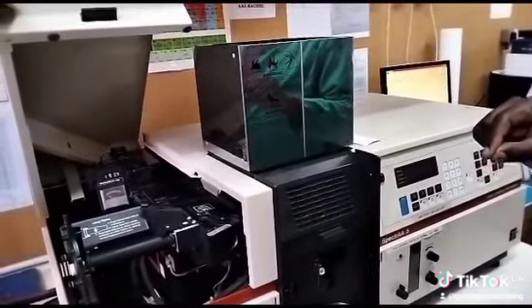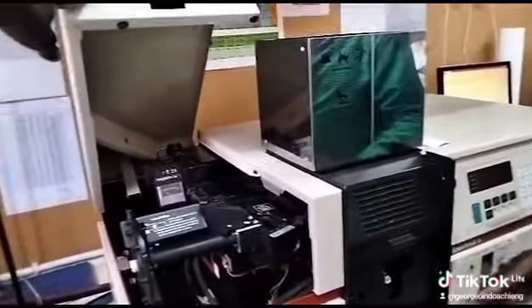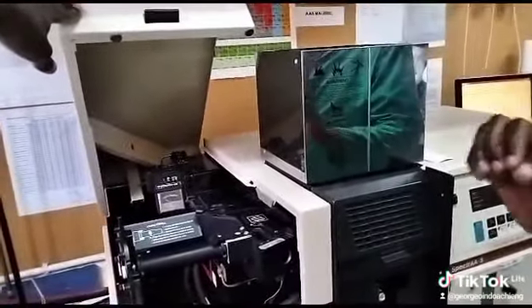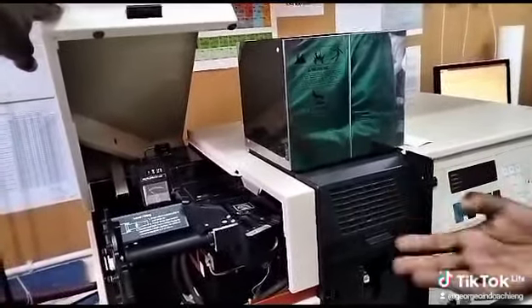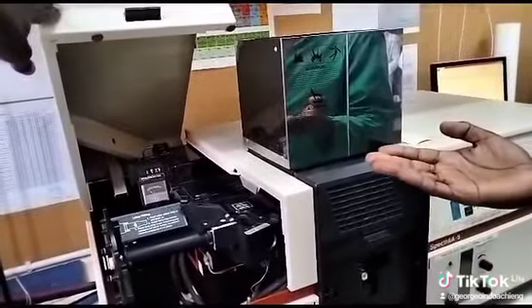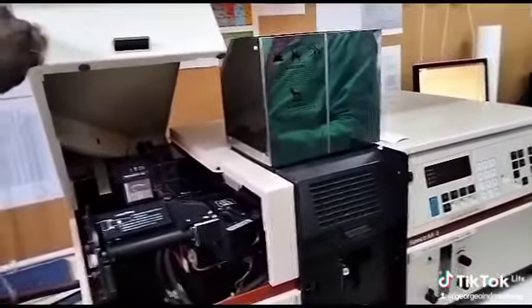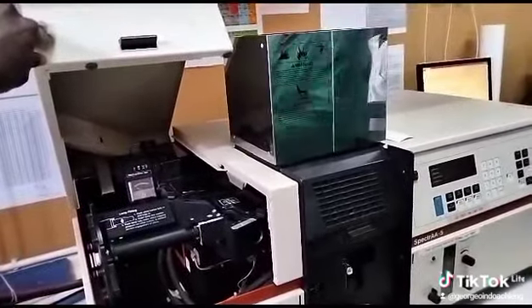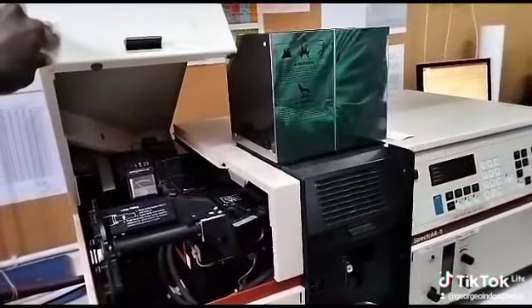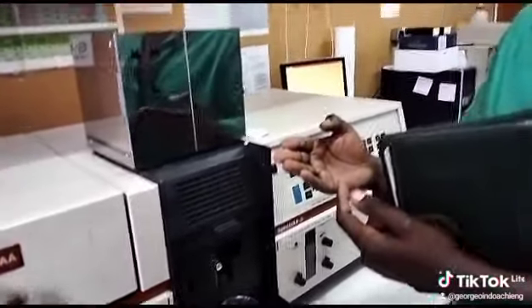That will be done against the standard curve generated using the standard concentrations. Whichever the sample, copper ore or any product that you wish. Now, what matters is how you prepare your sample. The target, of course, has to be in liquid form. So you can begin from liquid to liquid, or solid to liquid. It's just a matter of preparing your sample.